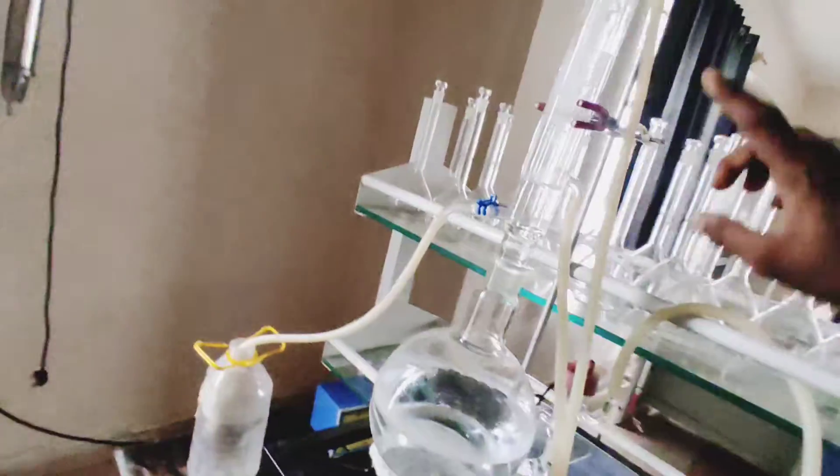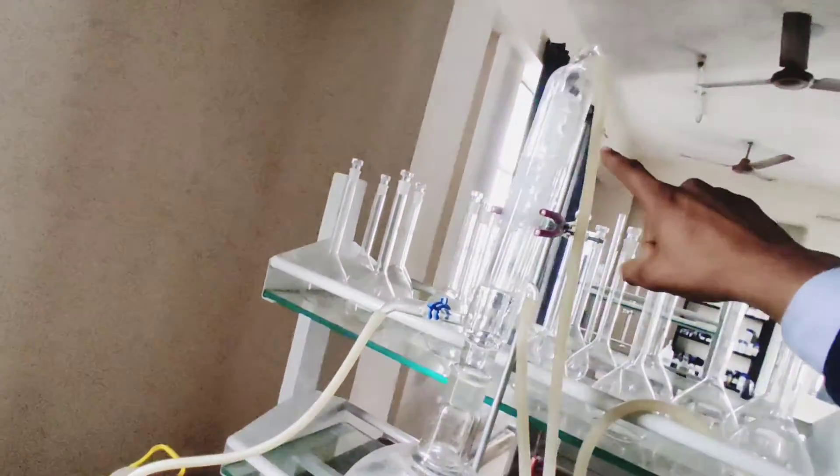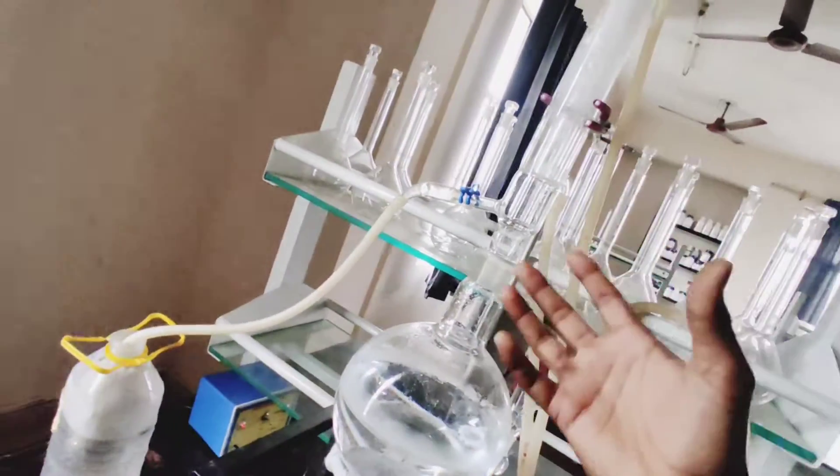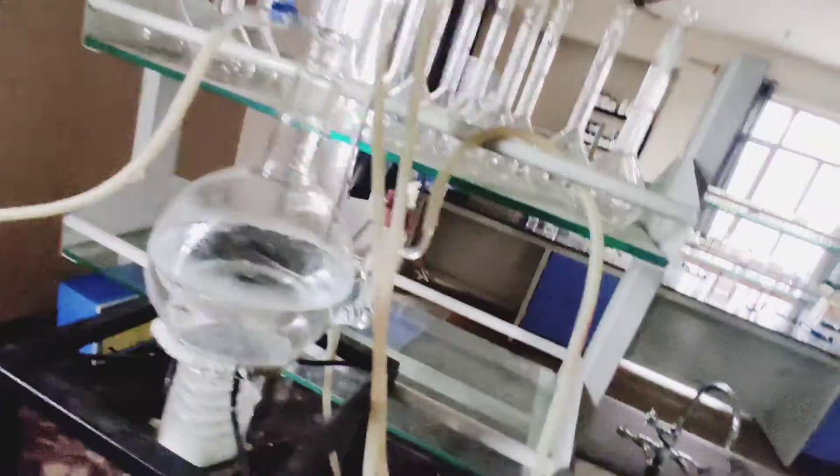After that, if you don't use water here, then it will not make steam and it will not make distilled water. So we are going to open the tap so that the water is flowing. When it is flowing then it will work, and that's why there is a little wastage here.